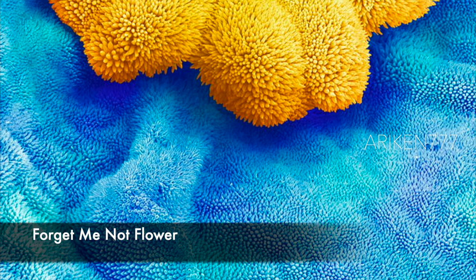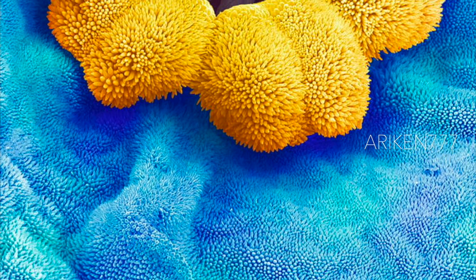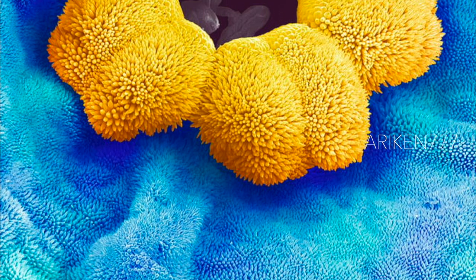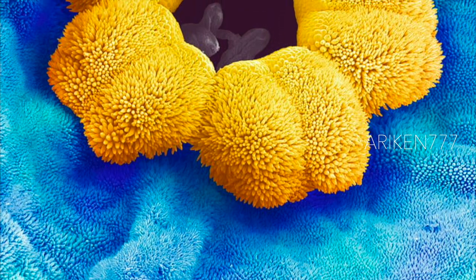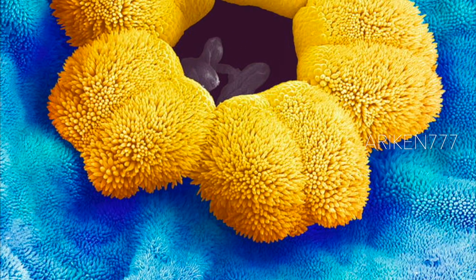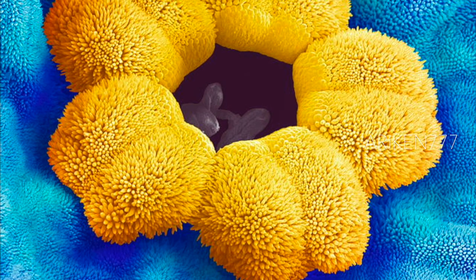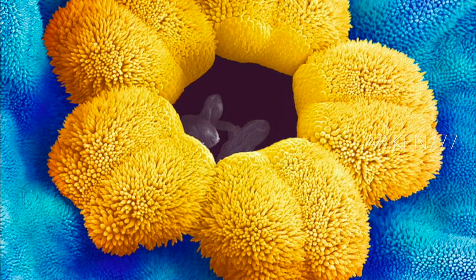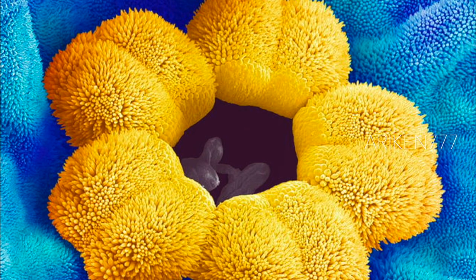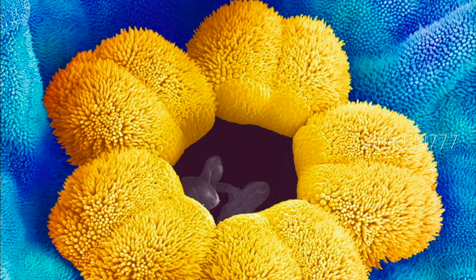Forget-me-not flower. The petals are covered by numerous projections called papillae. Collectively, the petals are known as the corolla. At the center of the flower are the male and female reproductive structures. The stamens, in yellow color, produce male gametes in the form of pollen grains and are fused to the corolla. The female reproductive structures, not seen here, are located in the hole at the very center of the flower.